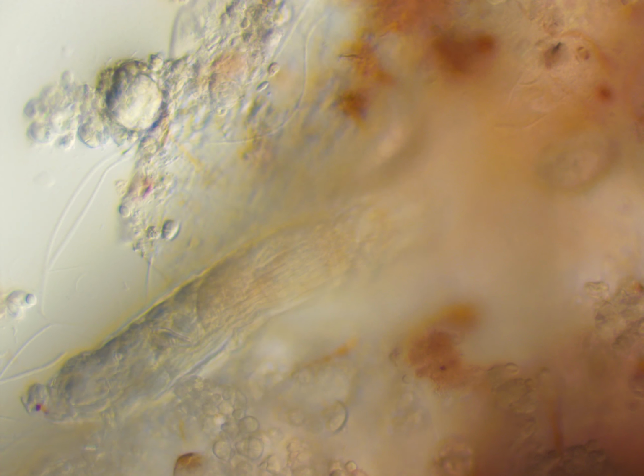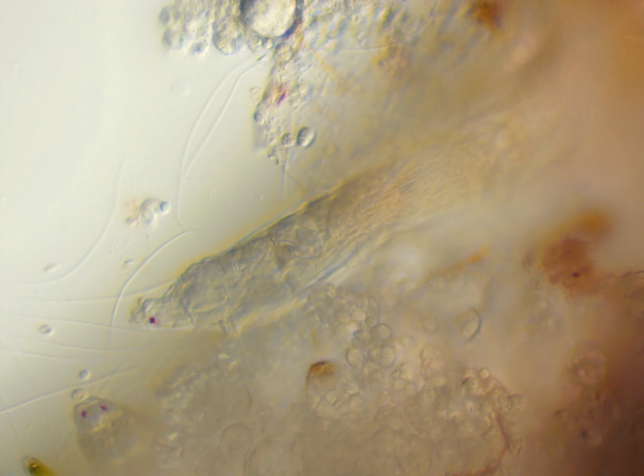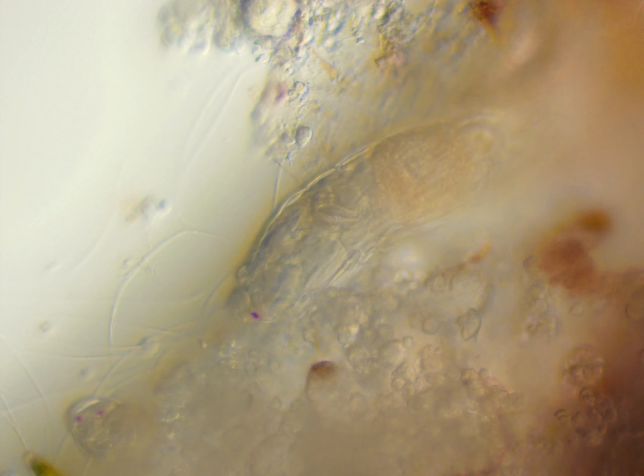You can see a small one, but here was a very nice looking rotifer. Here it is in oblique illumination next to another one of those rotifers. This one looked more like a bdelloid rotifer. It probably was from the genus Philodina.